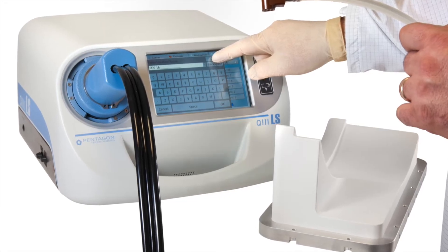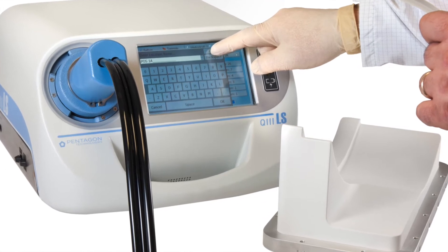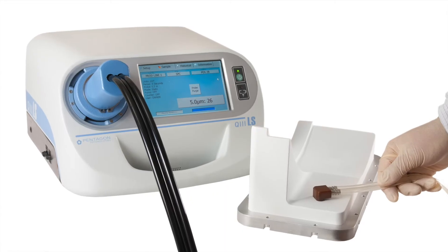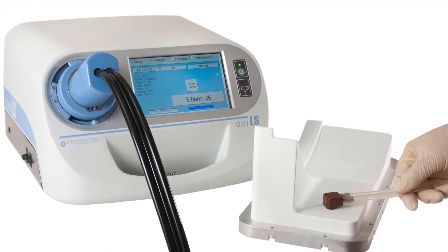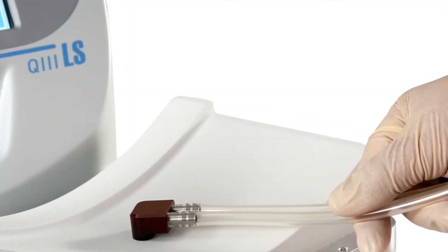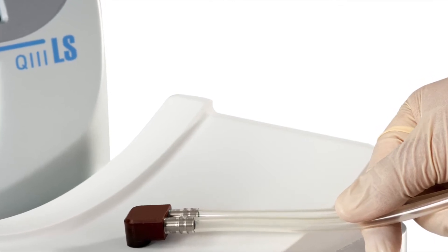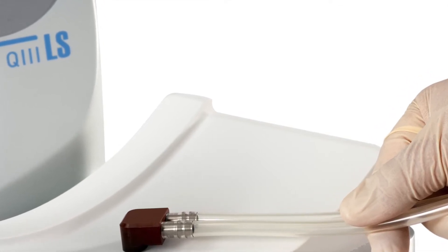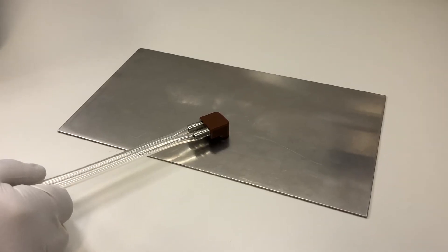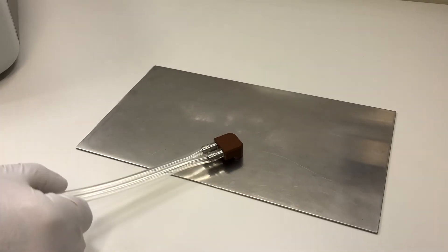You can also enter the name for the position you are about to measure by using the touch screen. To make a measurement, place the probe head lightly on the surface. Notice how the tube is held about 4 inches or 10 centimeters back from the brown probe head. Make sure to hold the probe head flat on the surface and avoid tilting or rocking the probe forward.